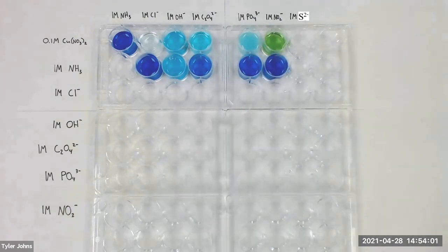We will next perform stability tests for chloride ion using the wells that are in the third row of the plate configuration. We will start with the third well because we already know how chloride and ammonia stack up from the previous set of tests. The other wells should be prepared in the same way as the corresponding wells in the first row.